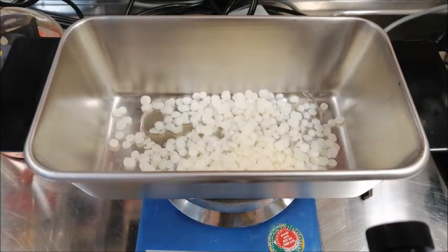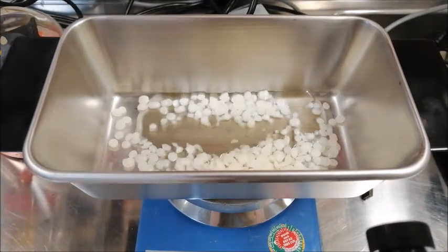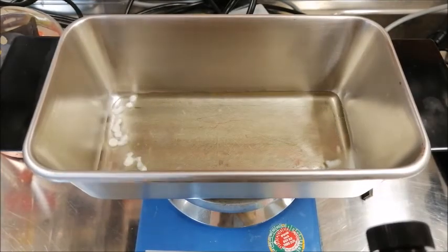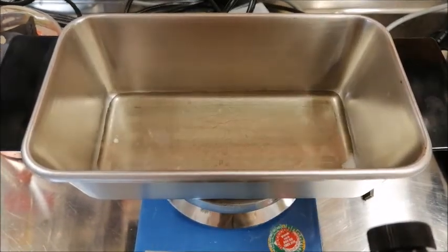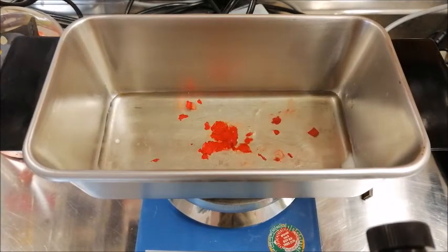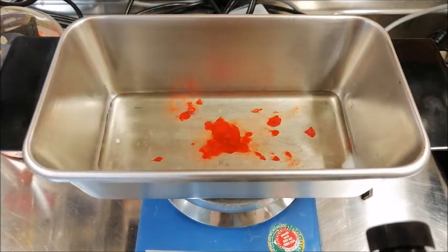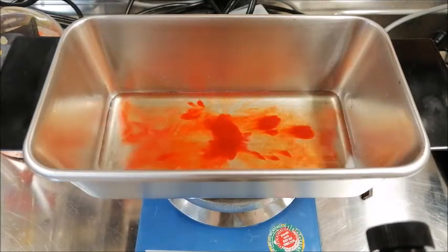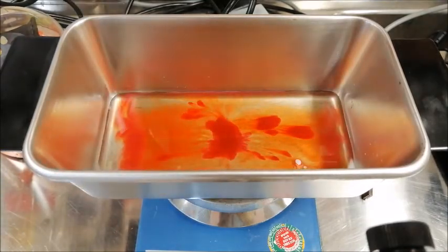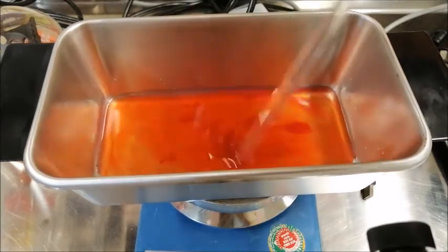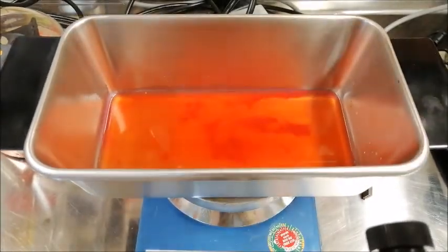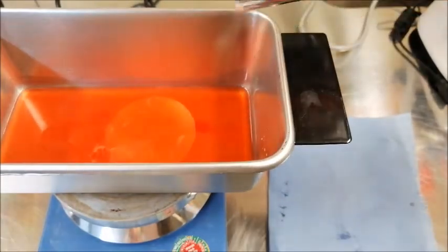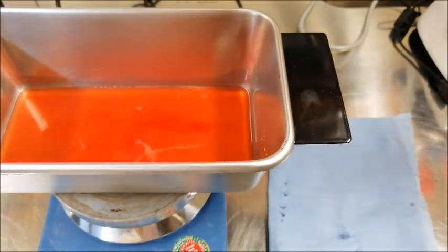To prepare the wax-soaked filter paper, beeswax is molten. In order to visualize the wax, a given amount of a red wax crayon is added and then mixed gently. Now, the filter paper is put into the wax for 10 seconds and afterwards is air dried.